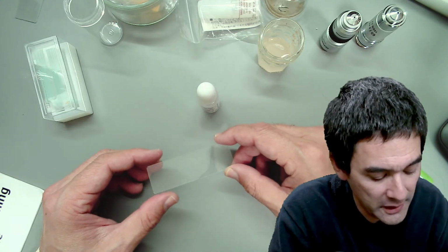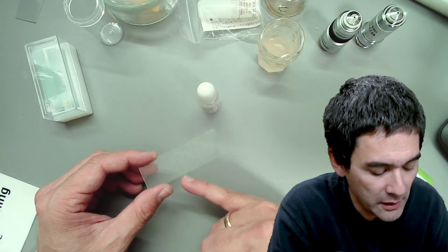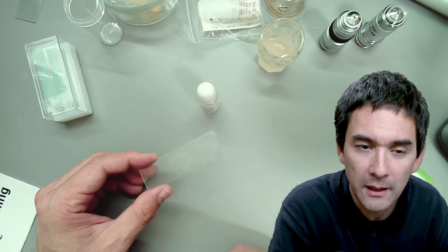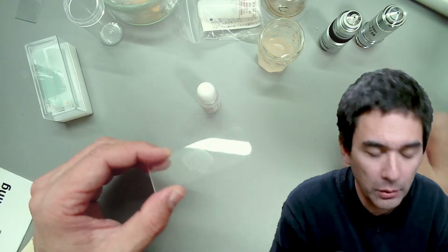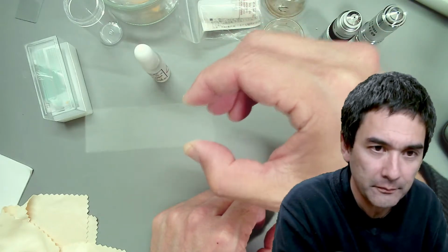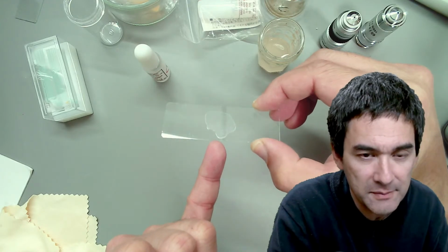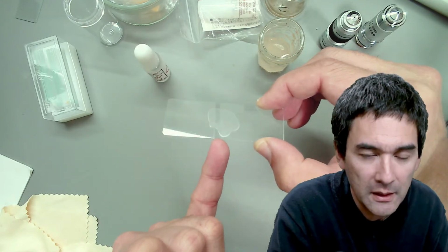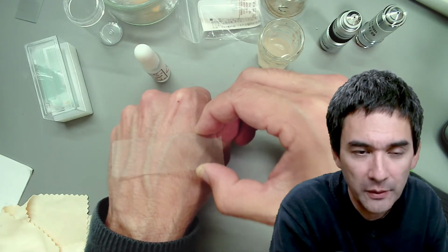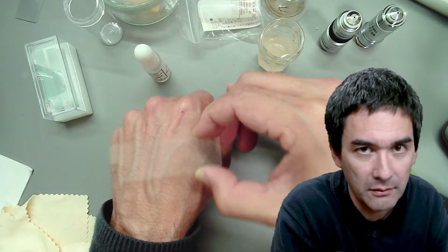You simply have to wait, depending on how much you've got, until all of the water evaporates, and then you have a very thin layer of cells on the slide. And by heat fixing it, I would pull the slide through a gas Bunsen burner about 2 times, with the specimen pointing away from the flame. How hot should it become? It should become so hot that you're just barely able to hold it. So it's got to be hot, but it should not burn you. That's the test, so to say.